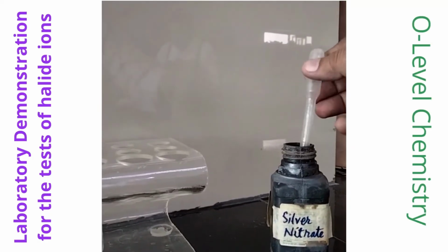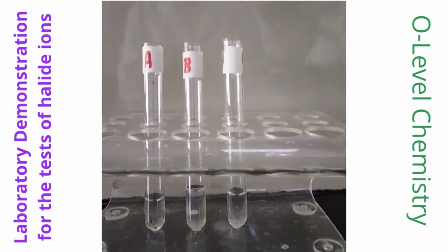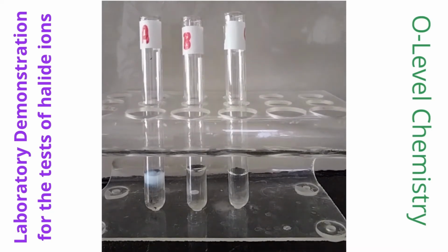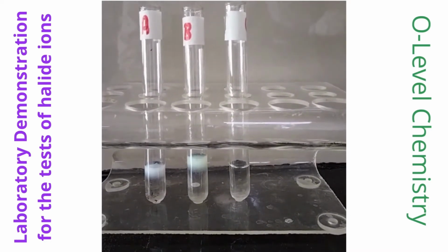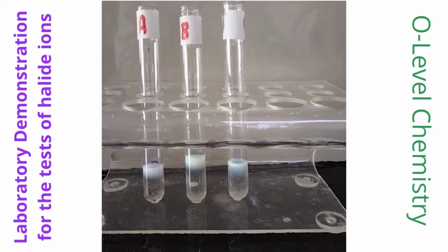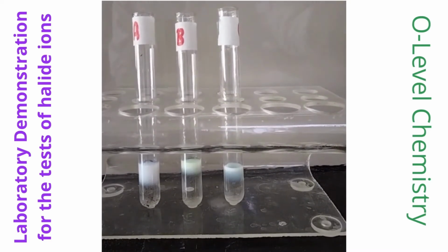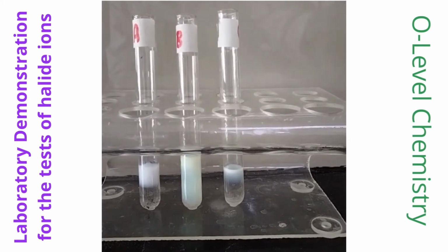Here, we have demonstrated how the test for identification of halide ions is carried out in the laboratory. 3 test tubes are marked A, B, and C. These test tubes contain salt solutions having one of the halide ions, separately. Then we add aqueous silver nitrate into all the test tubes A, B, and C directly through the reagent bottle or by a dropper. We can add more silver nitrate to produce more precipitates.